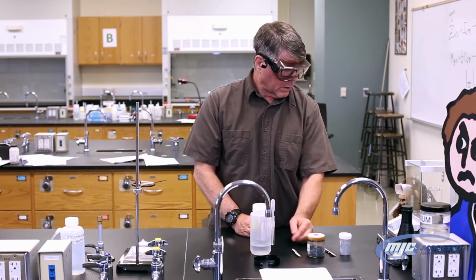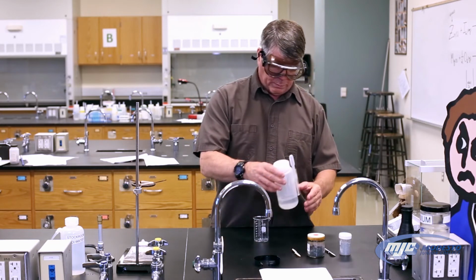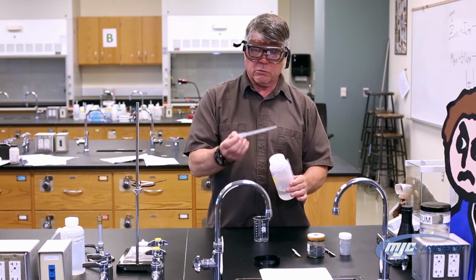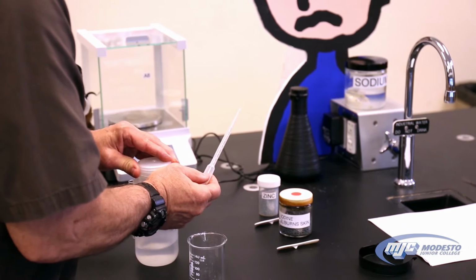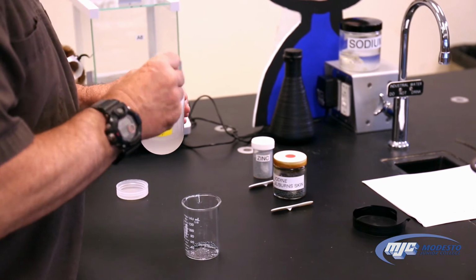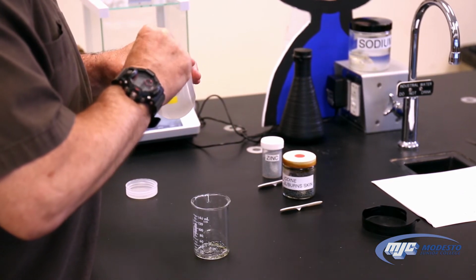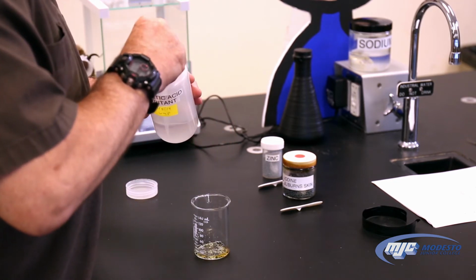All right, so we have this. Now, start the reaction going at a good speed. We're going to add about 5 milliliters of 0.2 molar acetic acid. This doesn't have to be measured out carefully, so I'm just going to use the transfer pipette. It has marks on it. Pull about 3 mils and then 2 mils, or really just 2 pipettefuls would be plenty. That volume is not real important. Maybe just a little bit more.